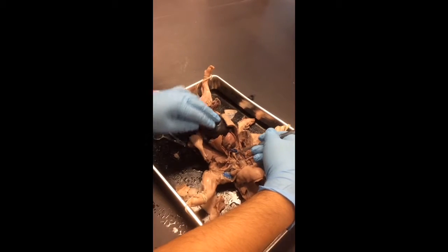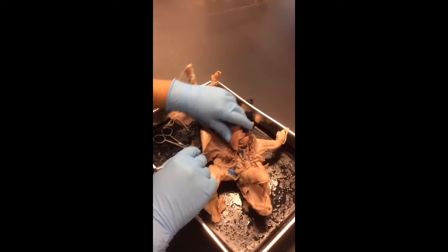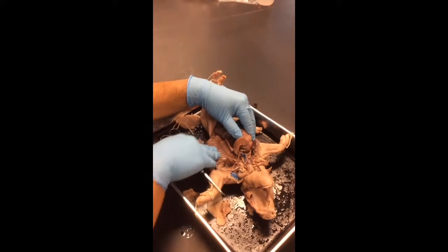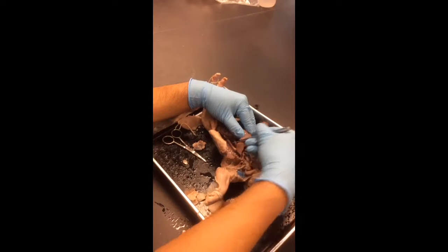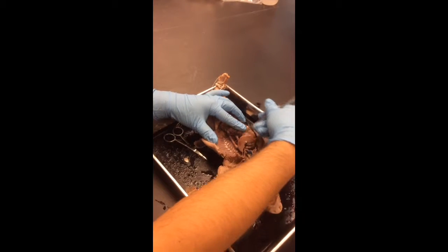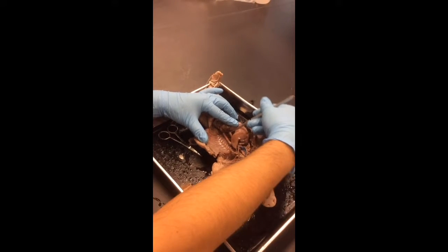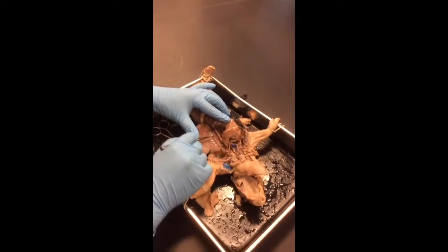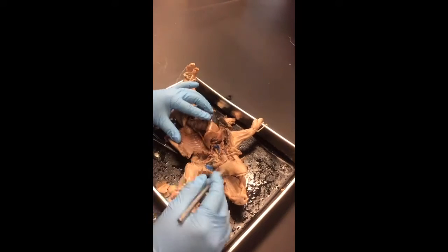Another place to see the esophagus, if you guys remember, is from the back. It's in the back. And here's the aorta, but the esophagus is right there as well. Okay. So if you see something brownish and flat, esophagus, the white tube is the aorta, but we'll come to that later.